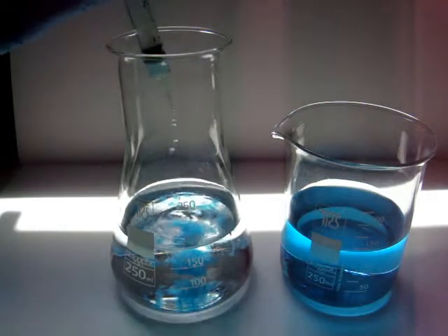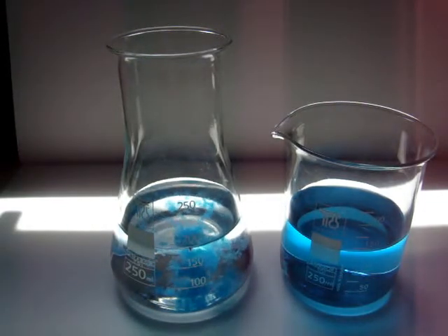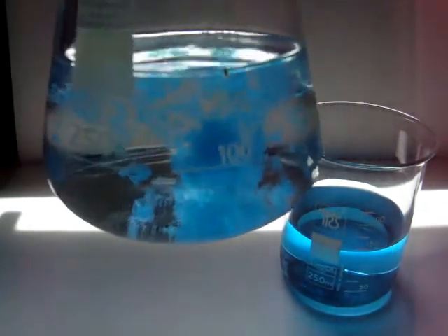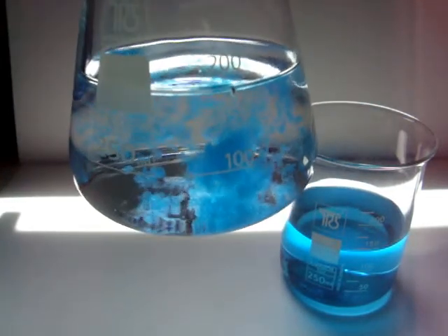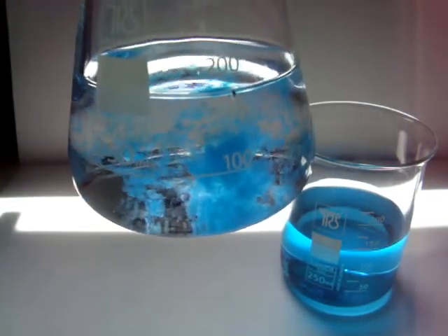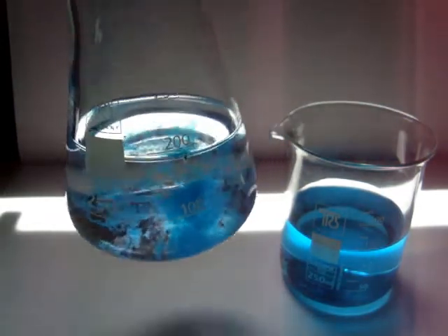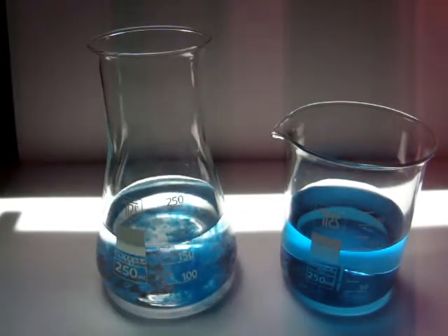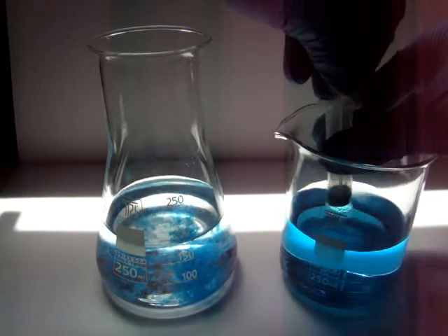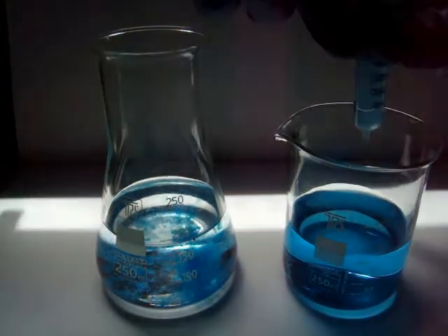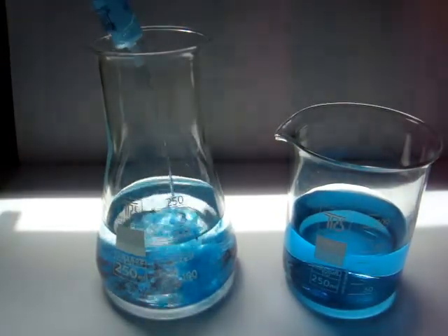In fact, while the sodium sulfate which forms is soluble in water, the copper hydroxide is not soluble at all. If you want, you can add all the solution from the beaker directly. I am doing it just to show you the precipitate patterns.